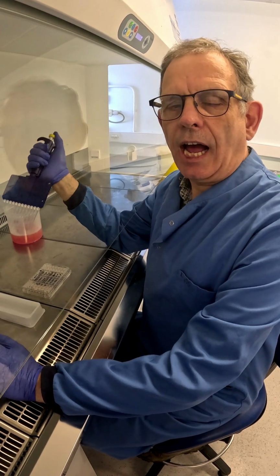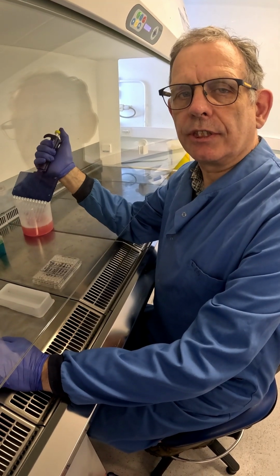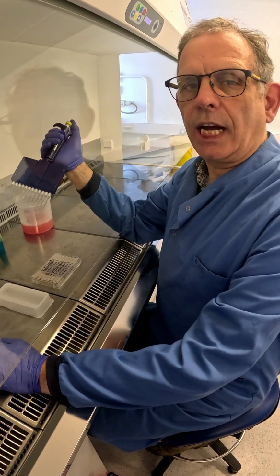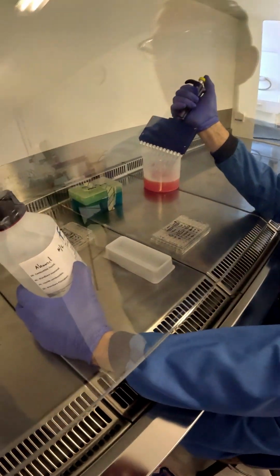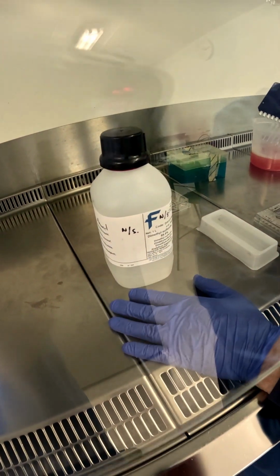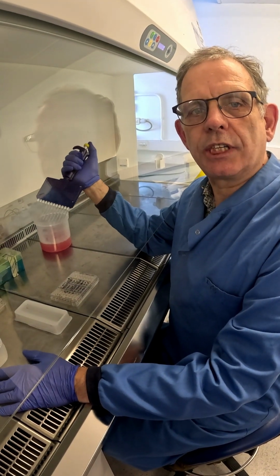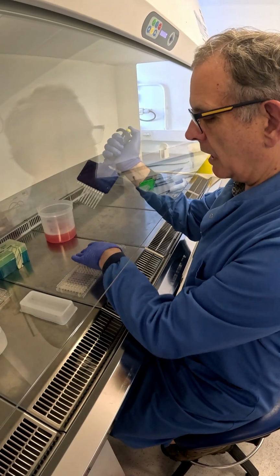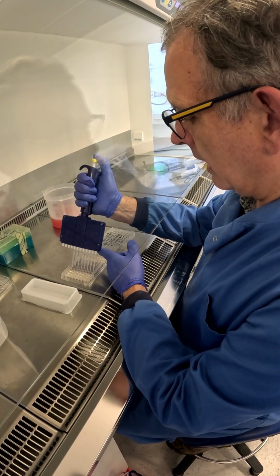A few moments later. Okay, finally, after we've harvested the supernatants, we are left with the insoluble crystals. The final bit is to solubilize them, and what we do is we add 190 microliters of DMSO, and the DMSO will solubilize the crystals into a clear purple liquid, and we can measure that absorbance by the plate reader. So I'm going to add the DMSO to each well that has seen the MTT.